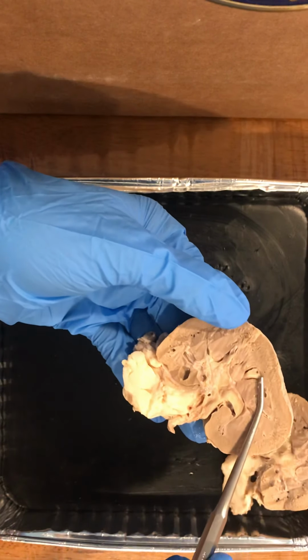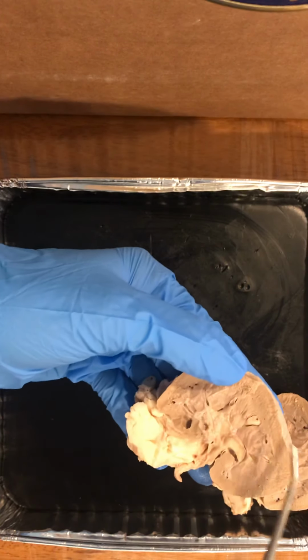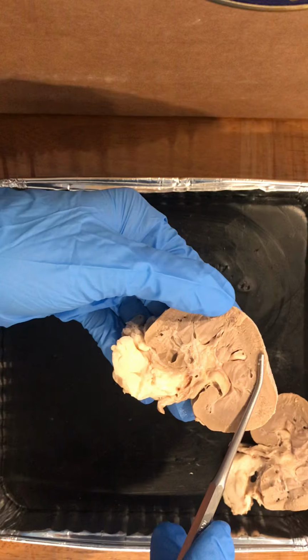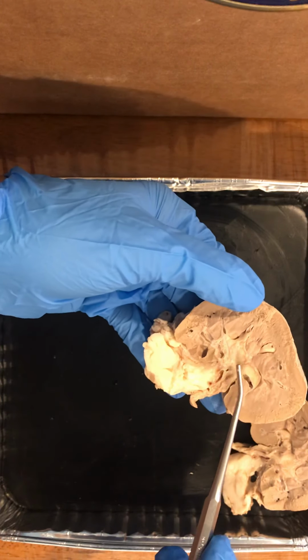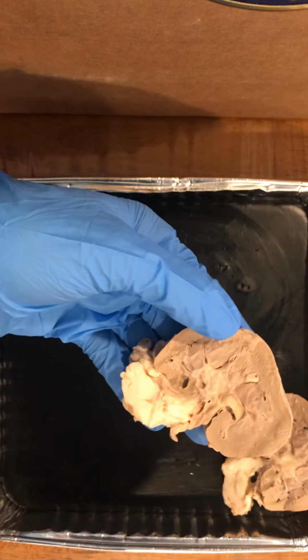A renal pyramid consists mainly of tubules that transport urine from the outer part of the kidney, where the urine is produced, and into the cup-shaped cavities where urine collects before passing through the ureter and into the bladder.